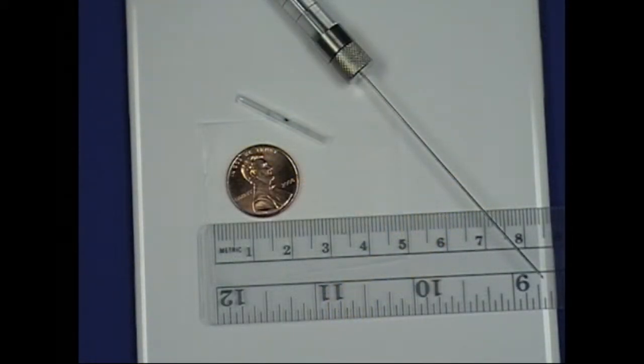The first thing to remember when you're making a sample for pyrolysis is that the sample is going onto a gas chromatograph, so the total amount of sample has to be compatible with a capillary GC column, and that's a very small amount.